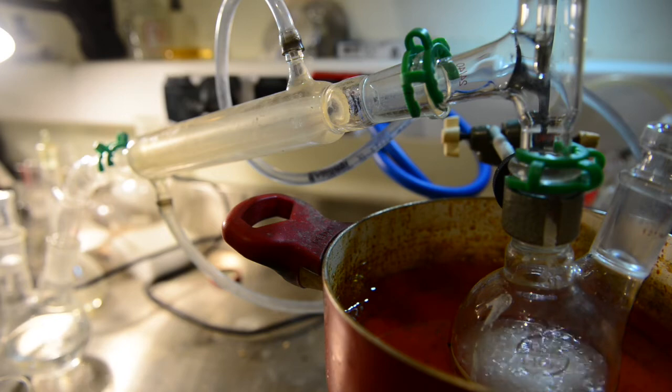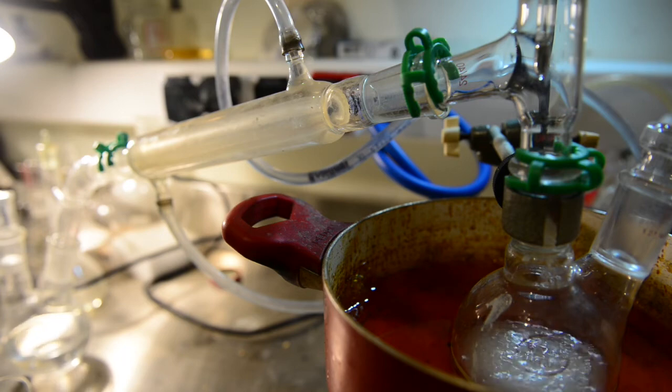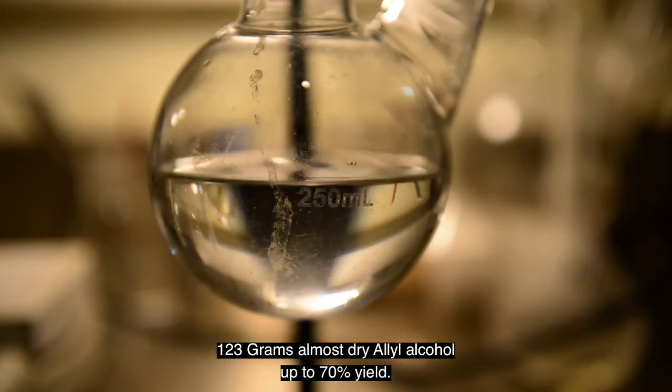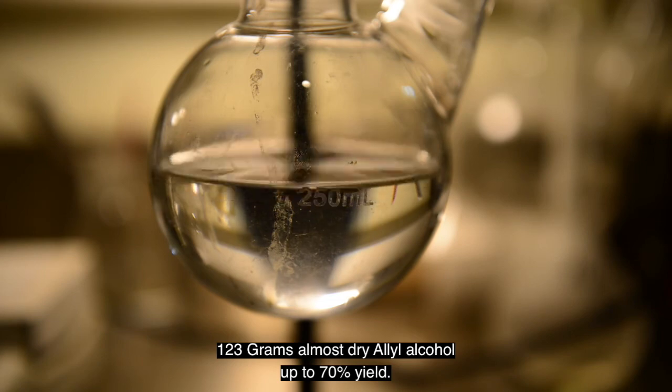According to the temperature, there had been some water present but it is much better than before. I will not process it further to avoid losses of product. It is not absolutely dry but pure and dry enough for our next step. A total of 123 grams of allyl alcohol was collected which represents 70% of yield.